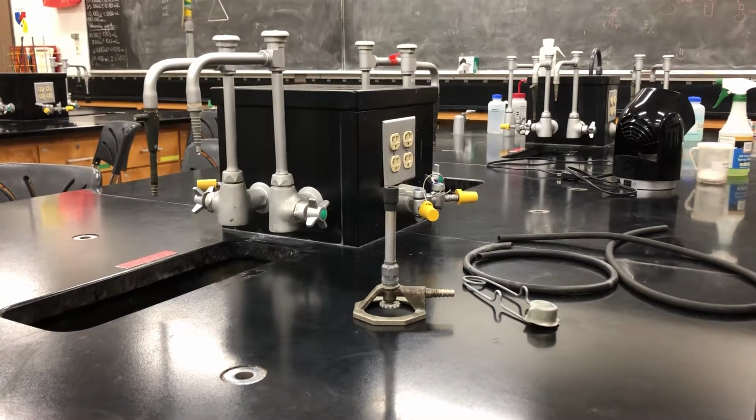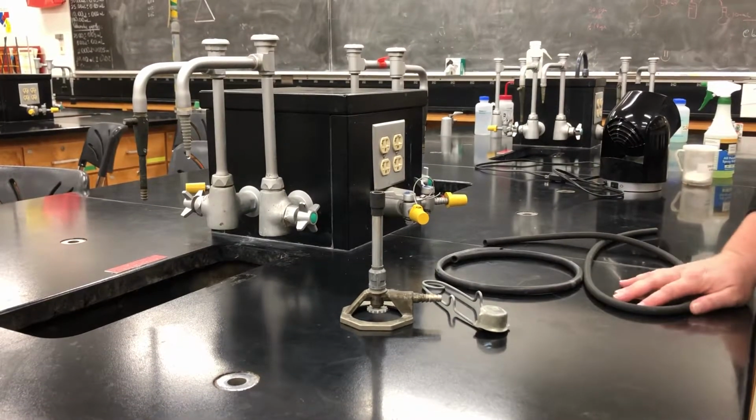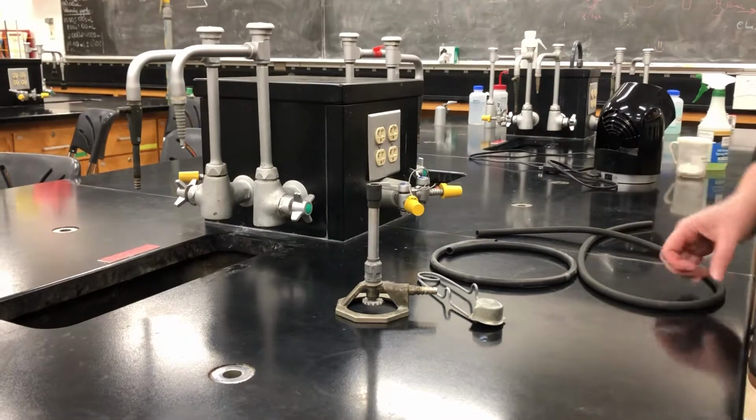Today we're going to talk about how to light a Bunsen burner. So I have my Bunsen burner, a striker, and a hose. I'm going to start by checking my hose. We want to make sure that it doesn't have any cracks or holes in it.